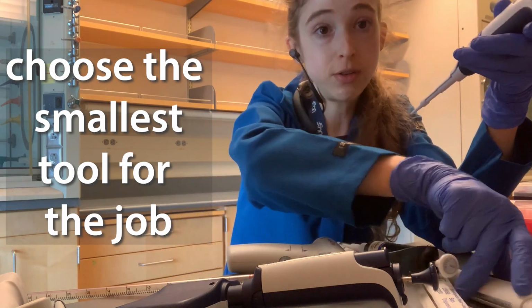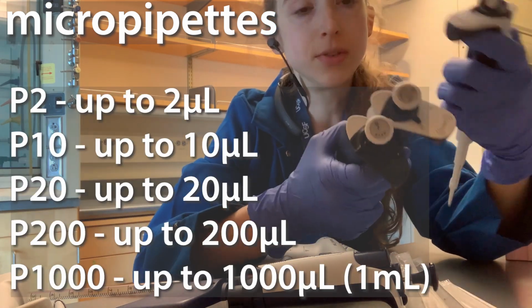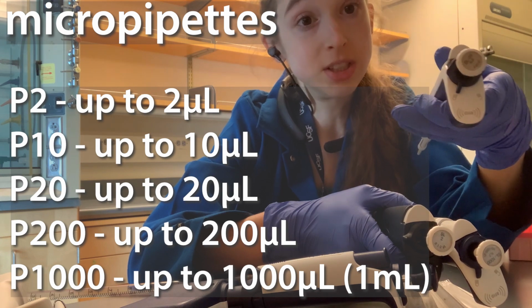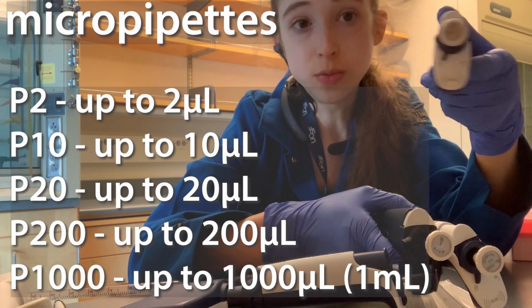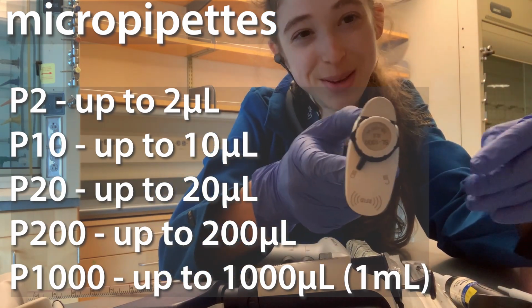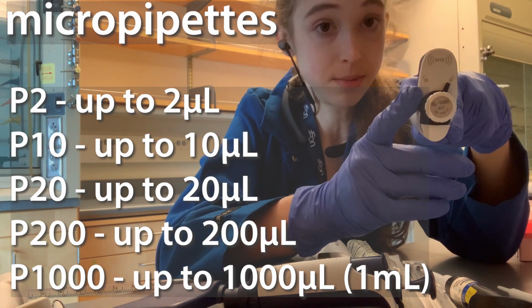So for example, these micropipettes come in a variety of different sizes. We typically refer to them by the name of the largest volume that they can hold. So for example, a P1000, 1000 is referring to 1,000 microliters. A microliter is 1,000th of a milliliter, which is the 1,000th of a liter. So 1,000 microliters is going to be a milliliter, and we call this a P1000. We can see here, oh, this isn't the P1000, so this one's the P1000. And so you can see this is 100 to 1,000. So this means it has a working range of 100 microliters to 1,000 microliters.